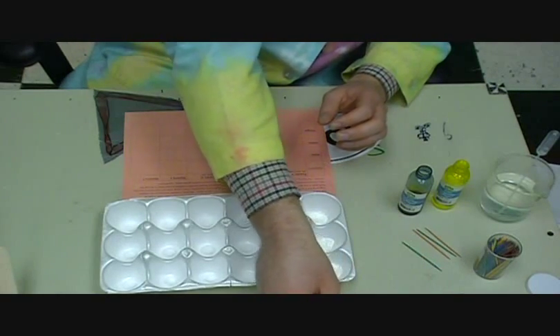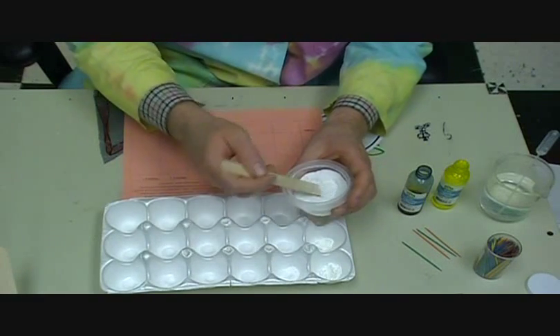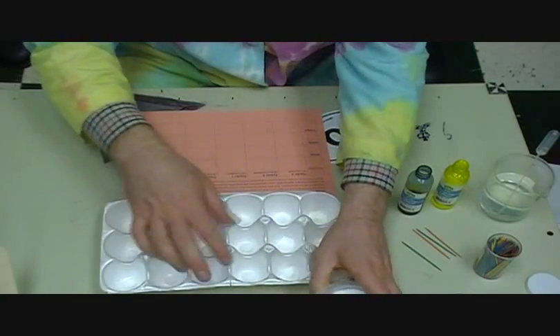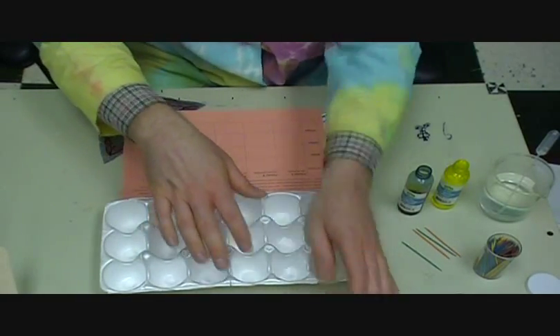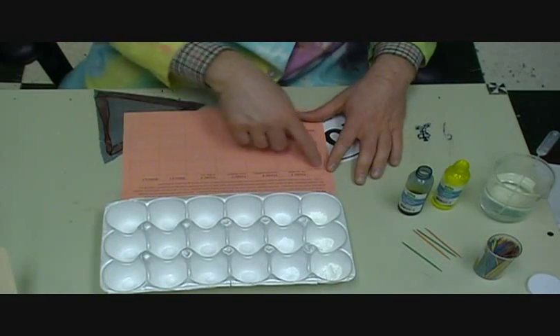And they'll put a little bit of B, a little bit of Grandma Mansfield's dandruff, in each of these second ones. Okay. And then, of course, C and D down the line. And so they'll have all of the mystery powders in these rows here. And then it says observations.